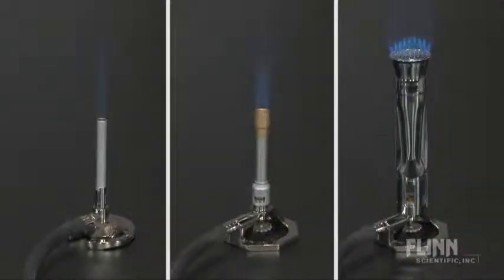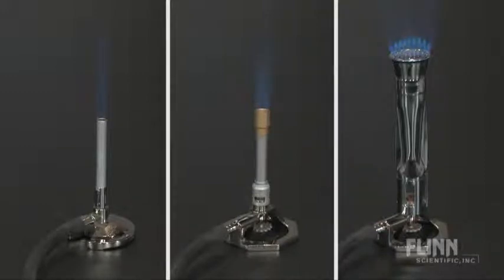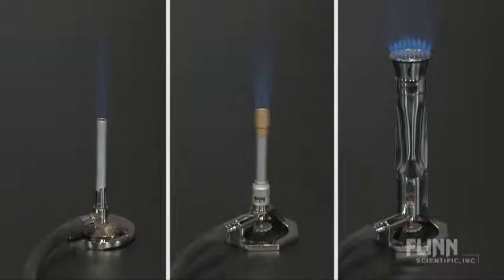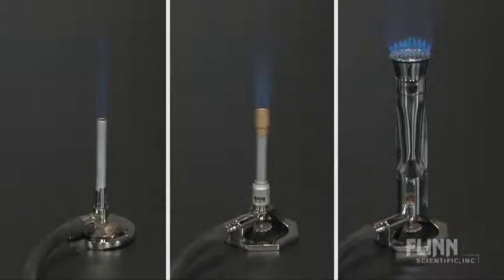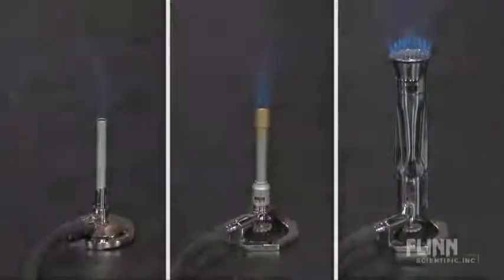Each burner has its place in a lab. Review your planned labs and demonstrations to determine which combination of burners best fits your needs.